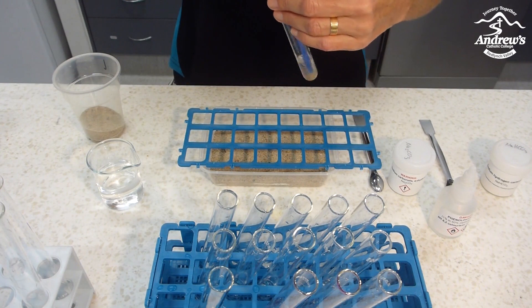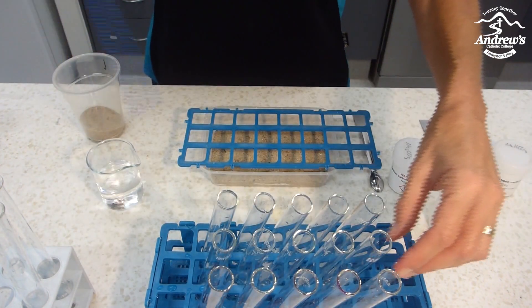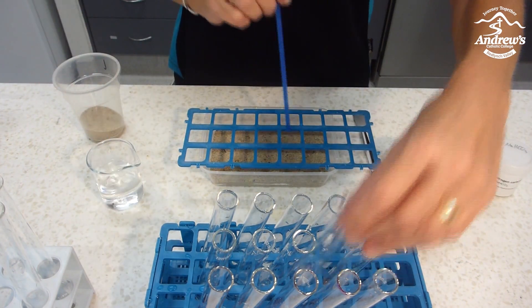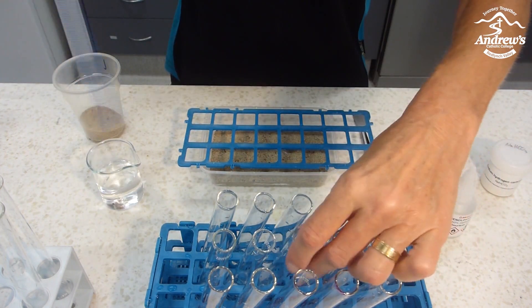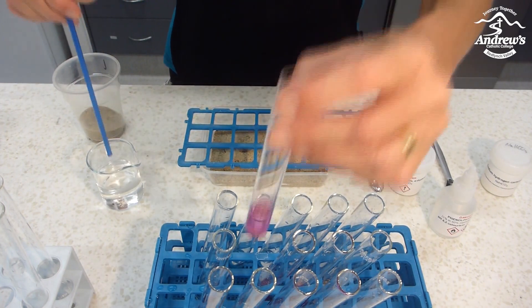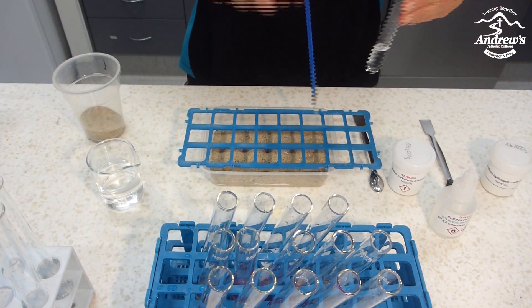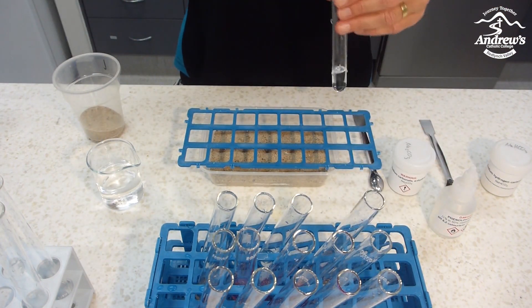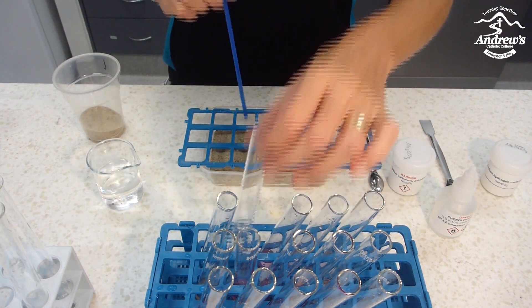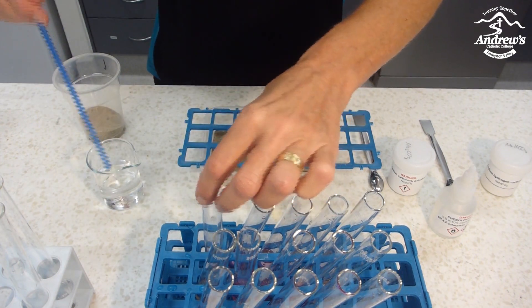Some will go dark pink, some will go nothing, some will go light pink. If you remember, in the corner I put sodium hydrogen carbonate, which is the low concentration, indicated by the light pink. Just work yourself through the grid. Nothing in the corner. A small deposit here, a small deposit there — still a little bit.